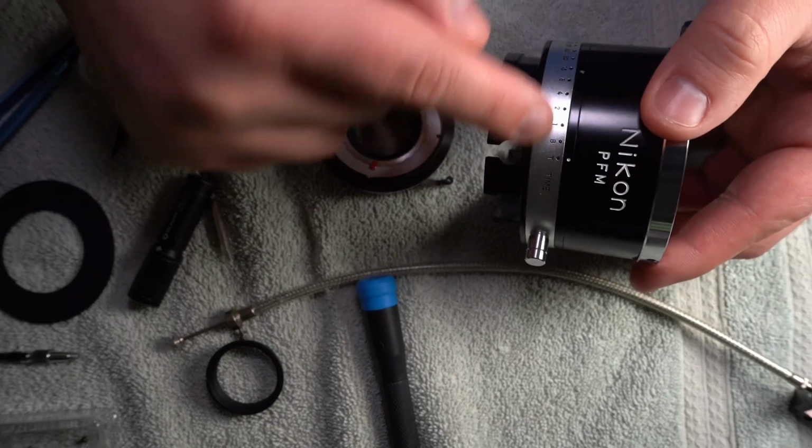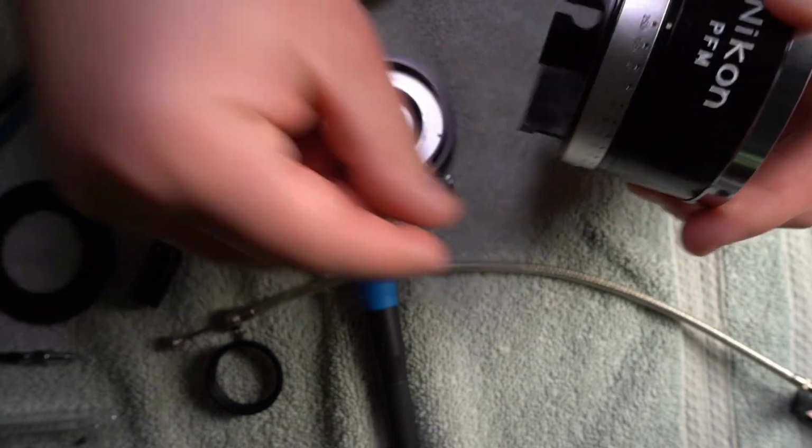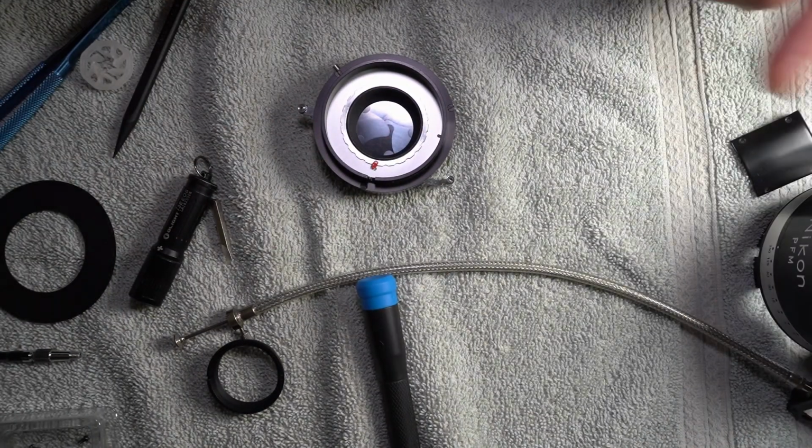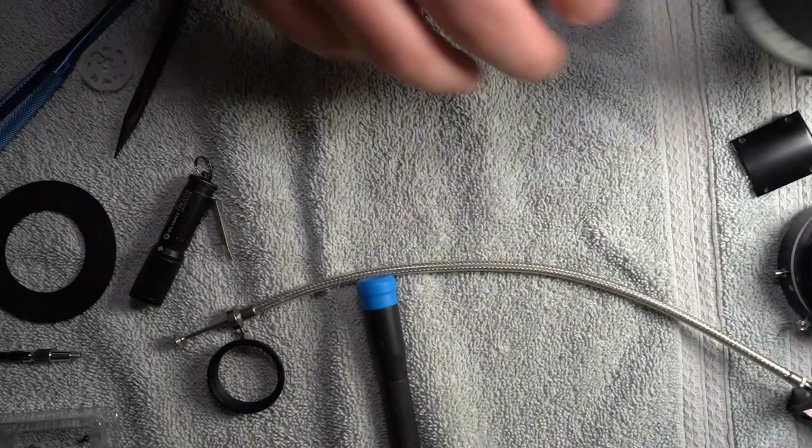So I'm trying to figure out where this thing has to go. So that was like those fastest, so I have to put it all the way over to that side. And then when I put it together, it'll make more sense. But right now, put that aside.